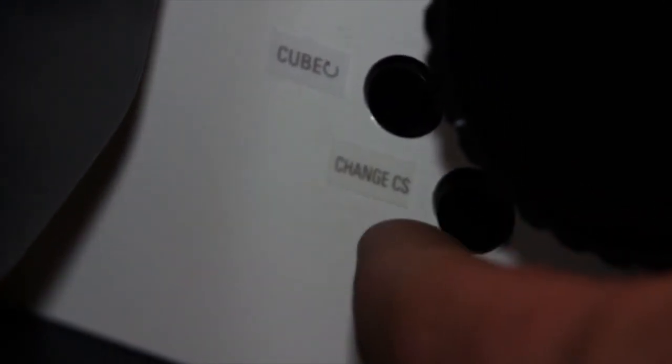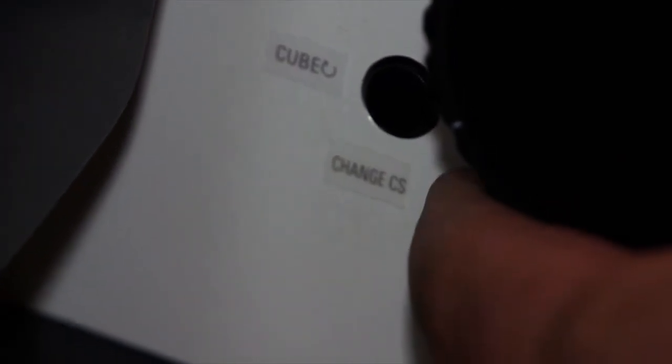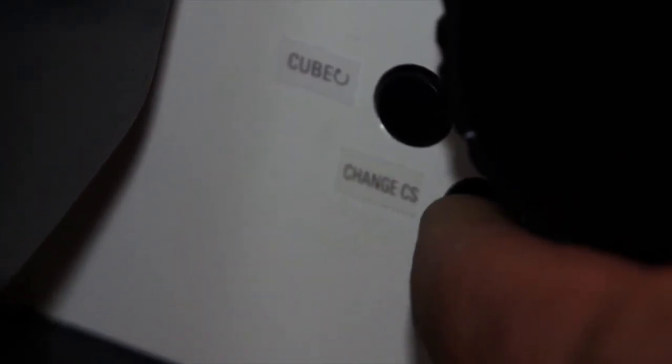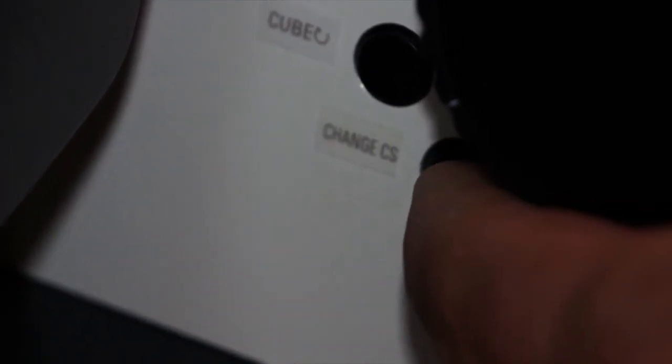observation in the microscope and sending the image over to the computer. So when you push the bottom button, it sends the image to the computer for scan mode. You can also go from scan mode back to direct observation through the microscope by pushing that bottom button.